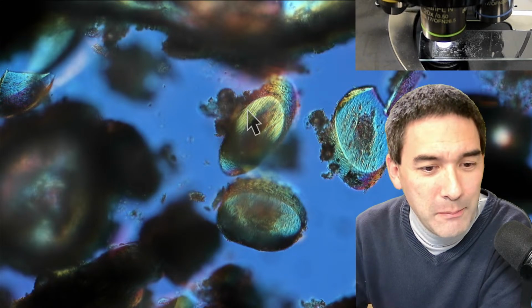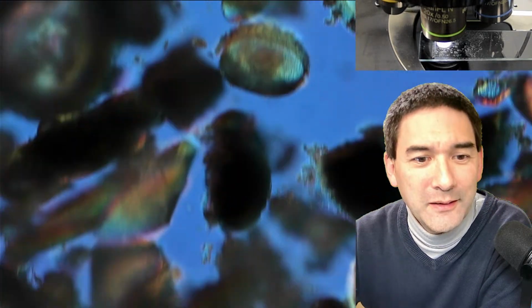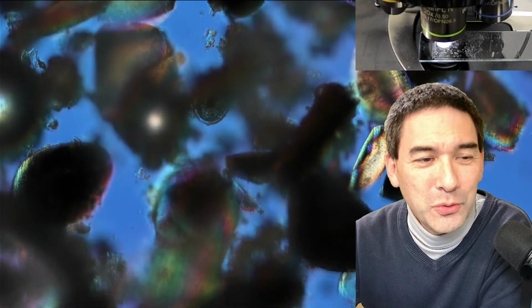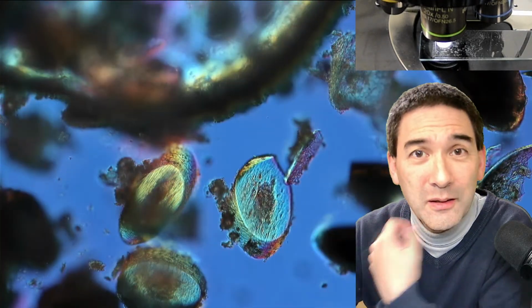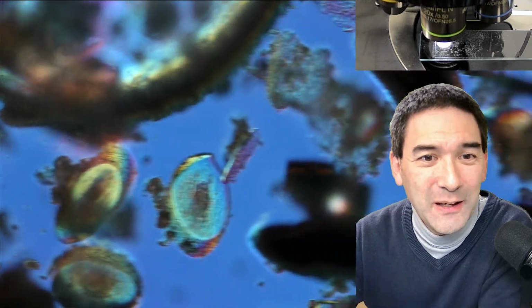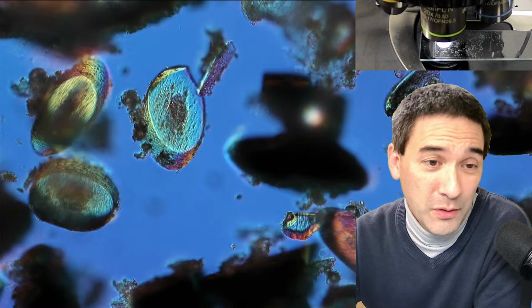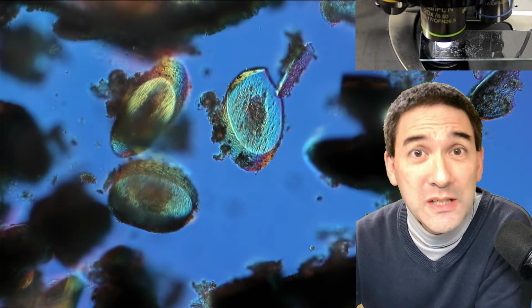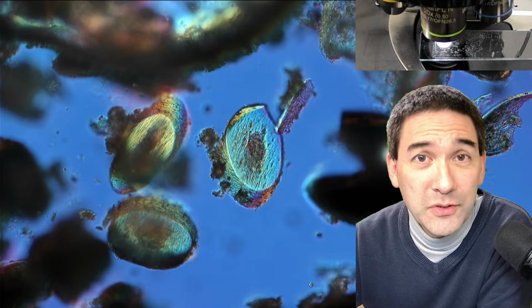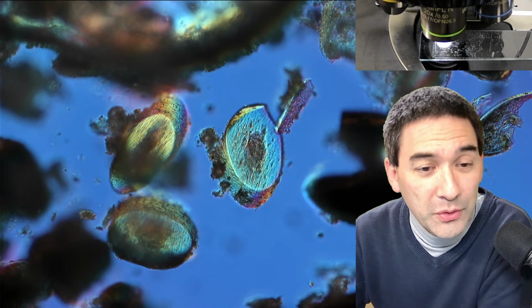No, it was not a microtome. I did not do that with a microtome. This is basically from this morning. I was shaving myself, and these are basically my beard. This is a very interesting way, actually so far the easiest way of getting proper hair cross sections.